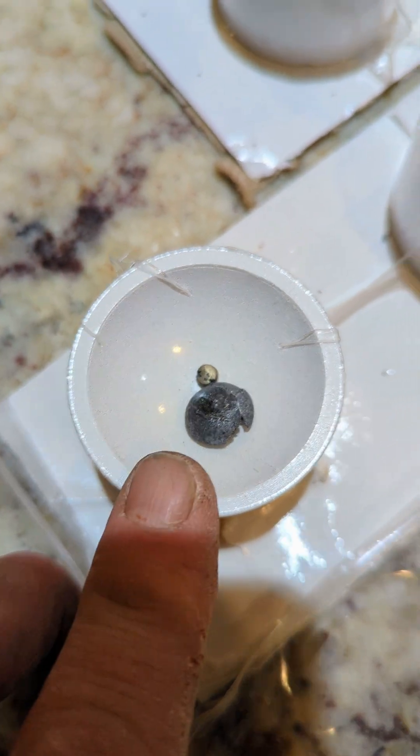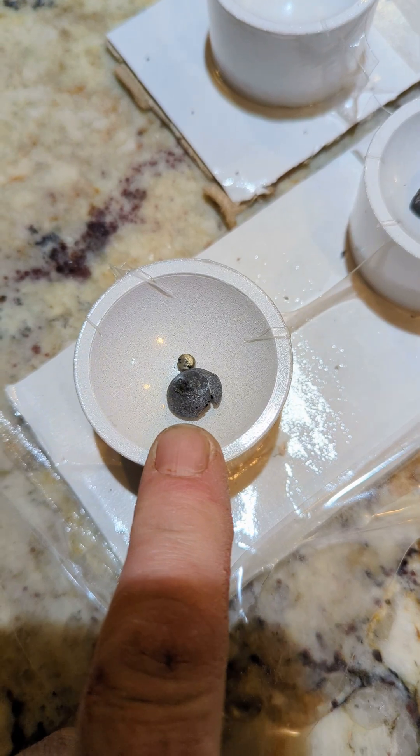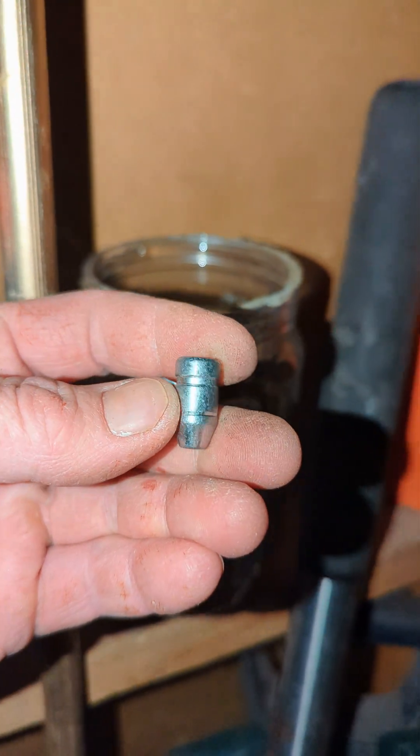I will be attempting to cupel all three of these in each dish. I may actually add 19.57 more grams of lead in this one. These two should be fine — just another one of these for that one dish should suffice.